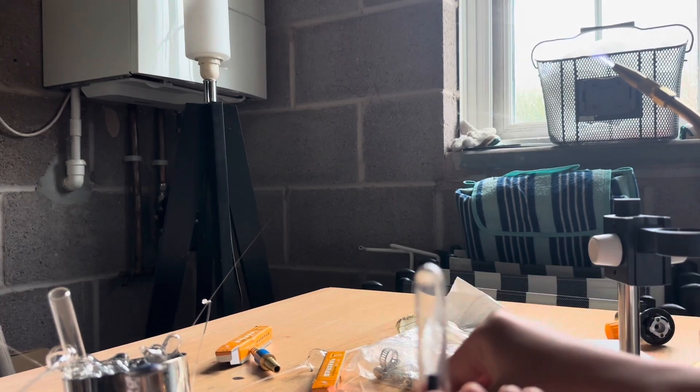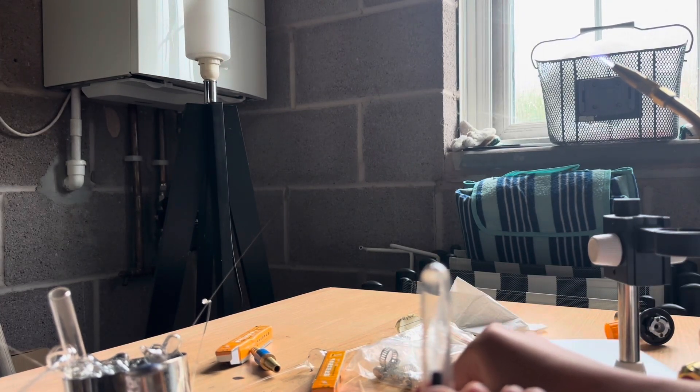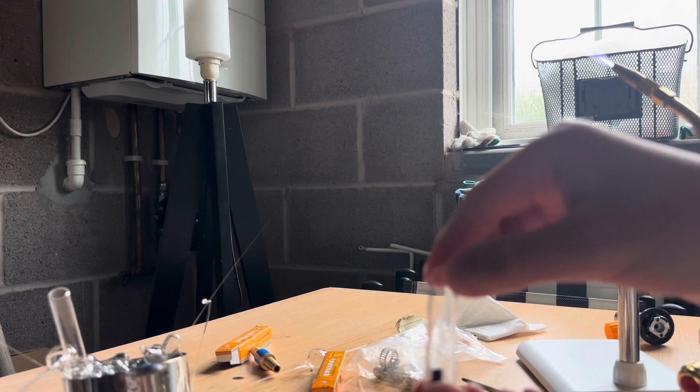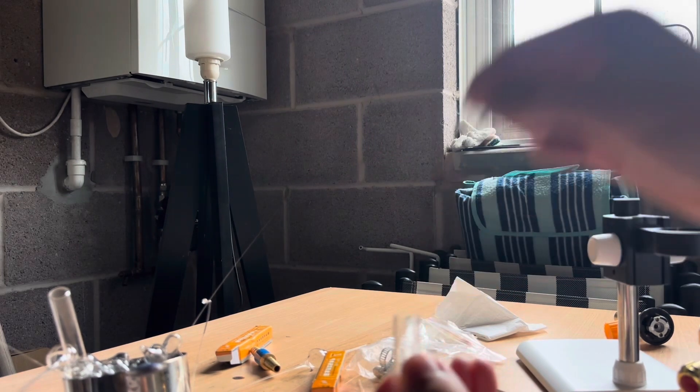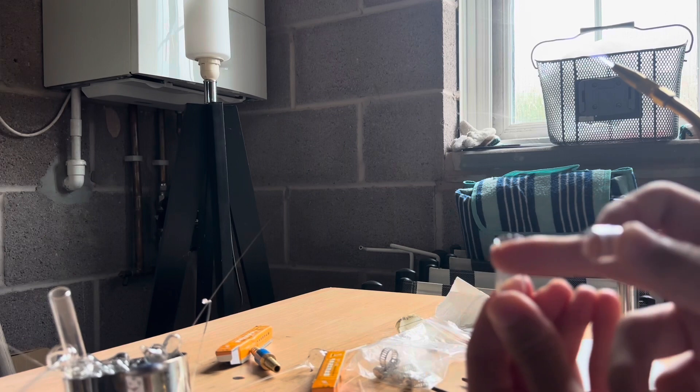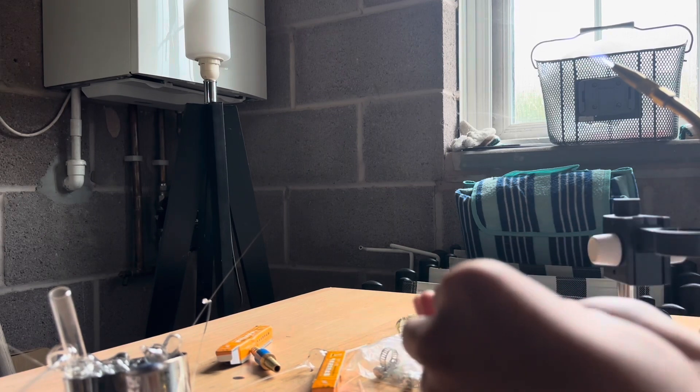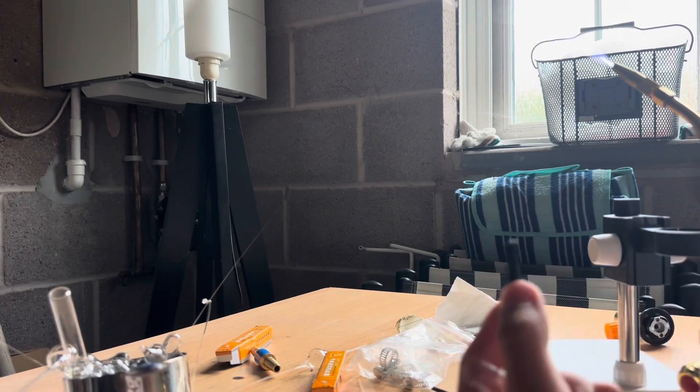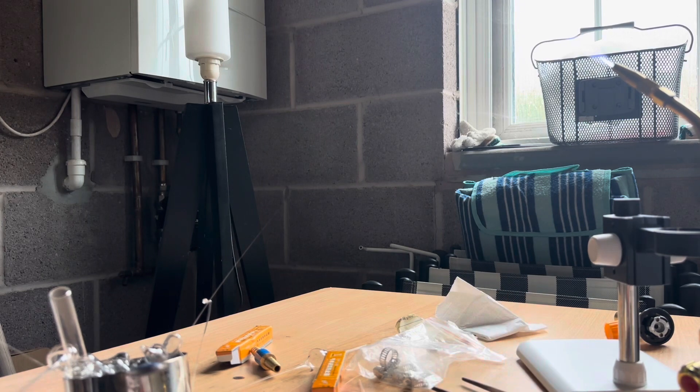Here we go, it cracked. We can remove the top section really really easily by simply bending the glass. Just like this, we get a perfect cut open. We can take out our little piece of rubber inside, as our stored sample.